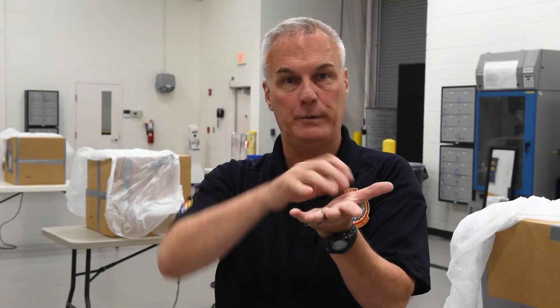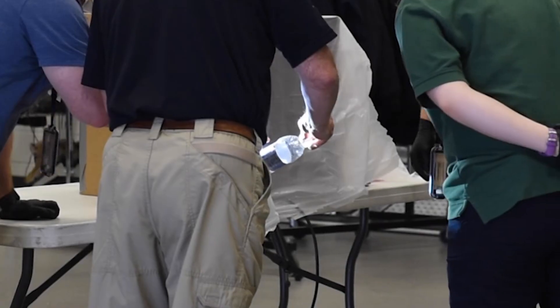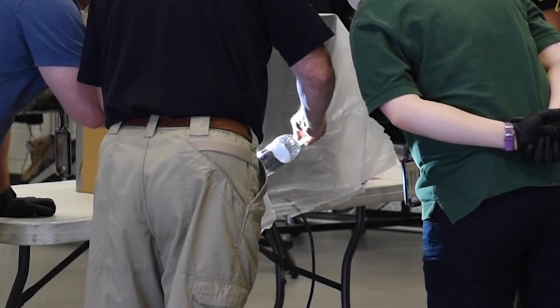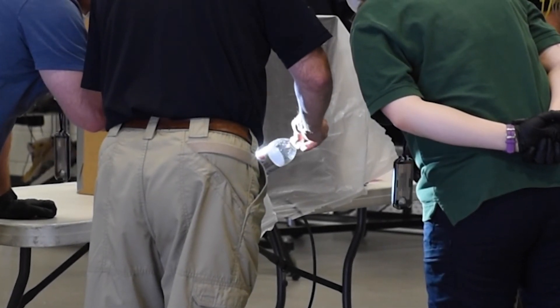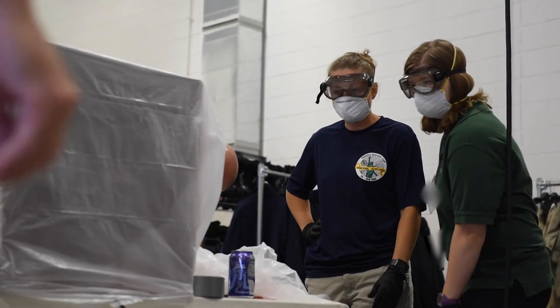By putting a little bit, it brings up the ridge detail just enough where it stands out from the surface, and then the lab later on can apply powder to it, ultraviolet lights, and so forth, to bring out the print to enhance it and identify it.